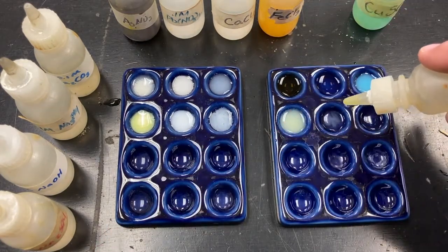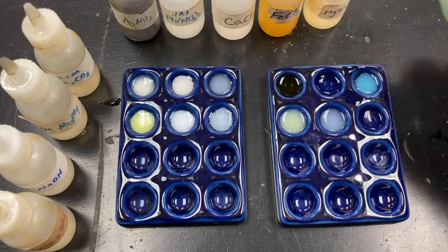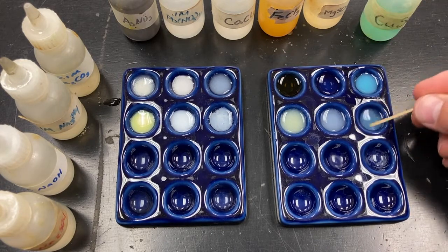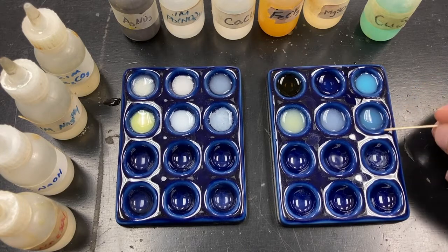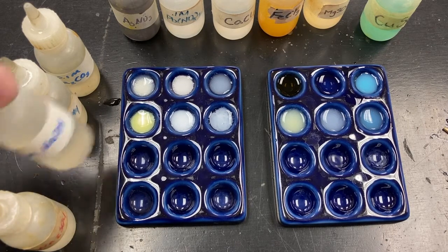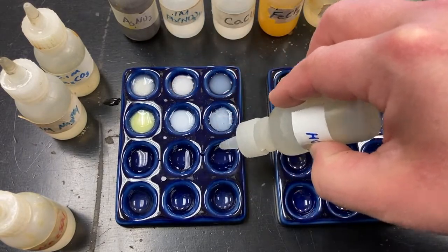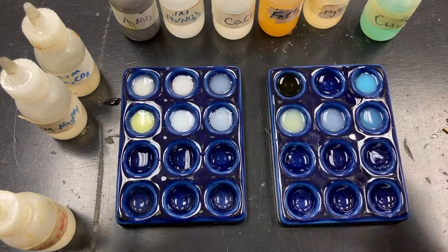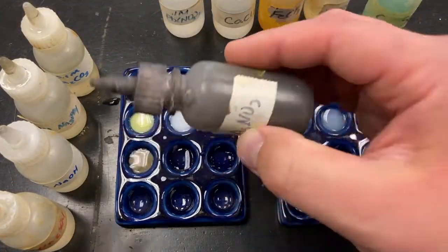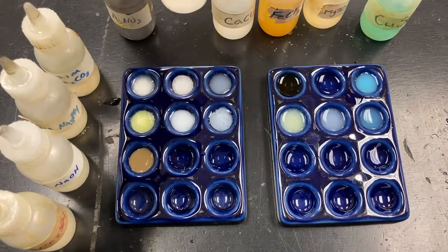Magnesium sulfate. A very fine white solid. Copper sulfate. Okay, very fine as well. Let's move on to sodium hydroxide. Okay, sodium hydroxide with the same 6 chemicals. Looks like it has a brown solid occurred.